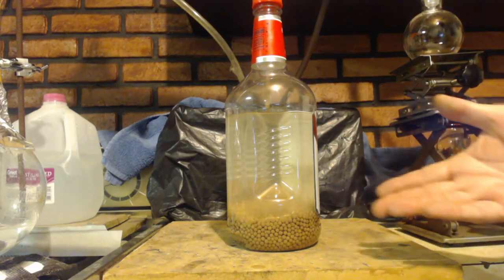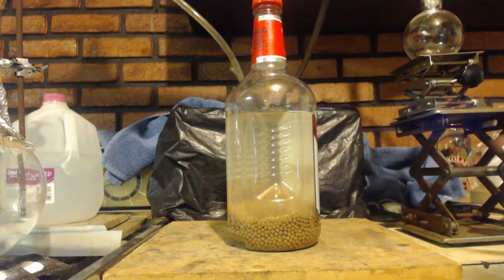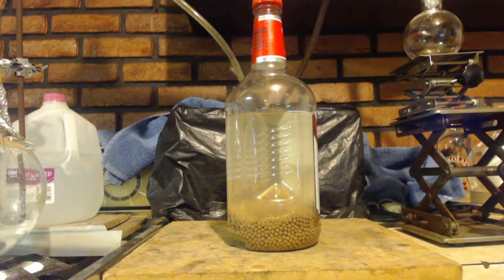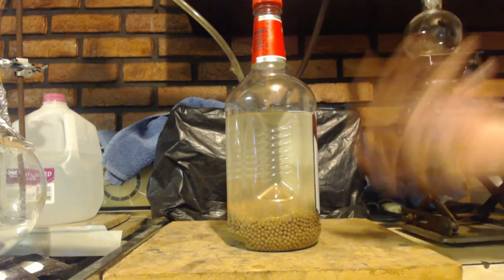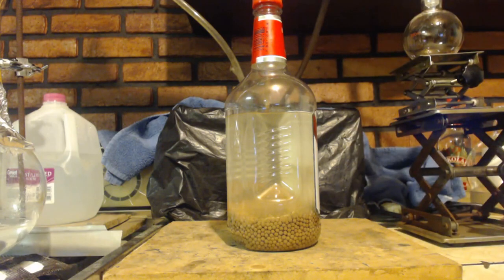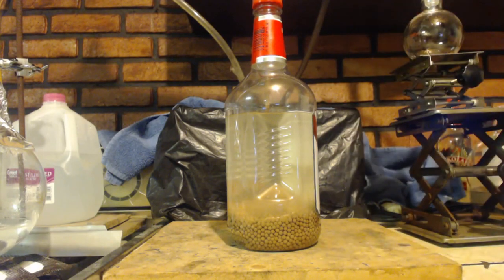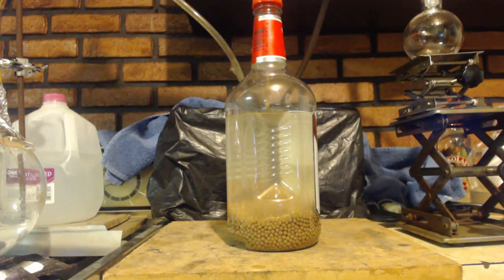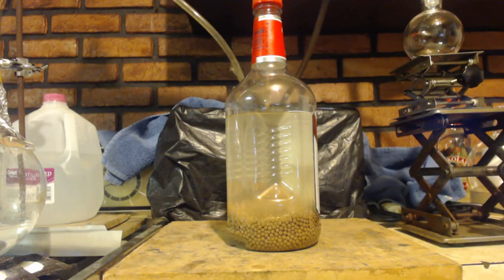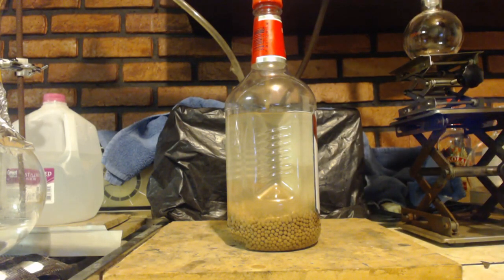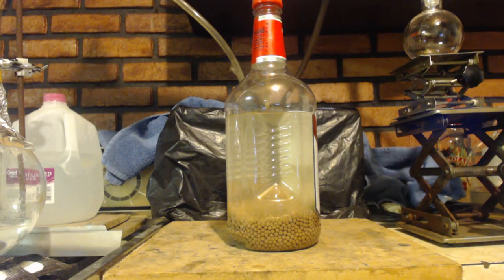Now I did the same thing with methanol. I didn't show it. But I put some molecular sieves in there just like I did with the water. I poured some methanol on it and there was a spike immediately by 5 degrees Celsius. An hour later, I noticed it was, or a half hour later, 20 minutes later, whatever, I noticed it had spiked 10 degrees. So it is absorbing methanol.